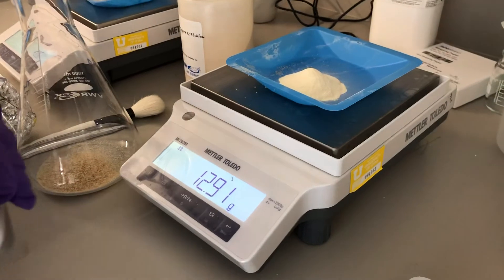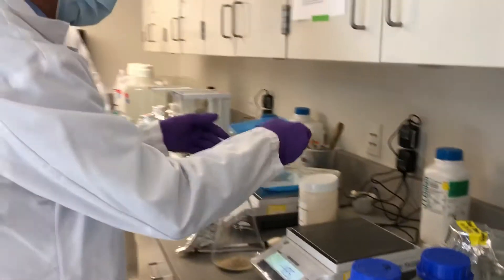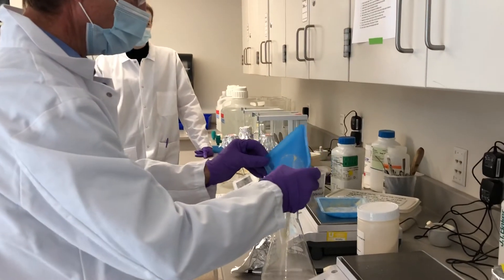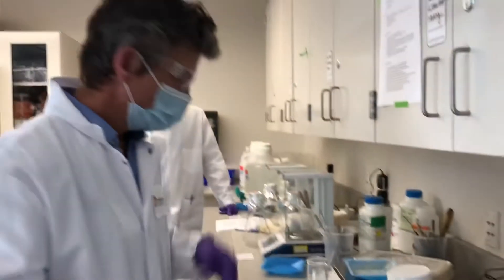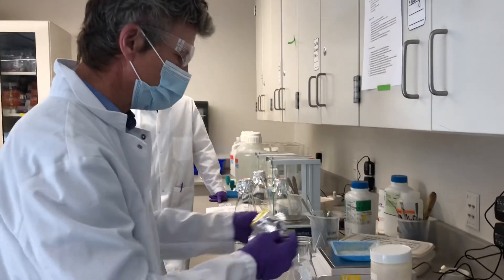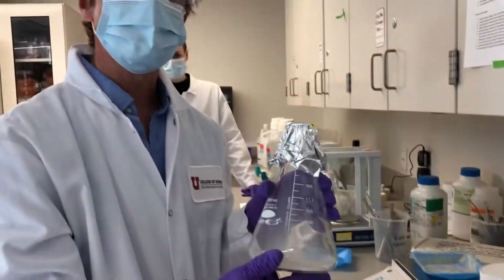There, 12.9—an extra 0.4 grams, not a problem. Pour it gently into the flask, and I'll save the weigh boat for the next student. There's no problem with cross-contamination. And here's our assembled LB agar medium.